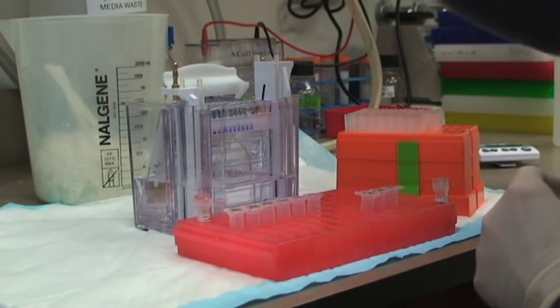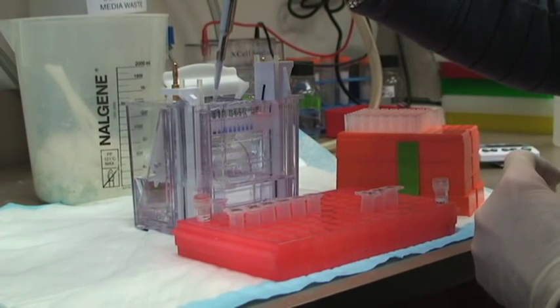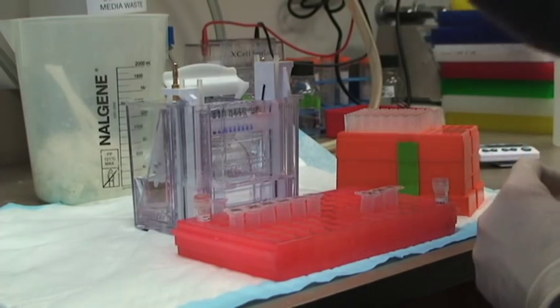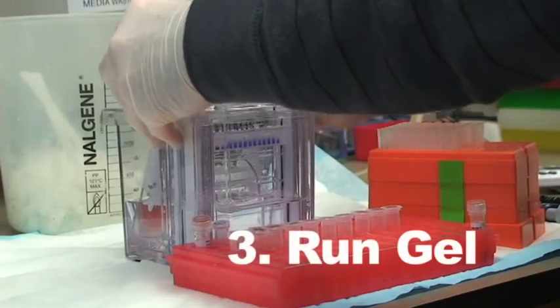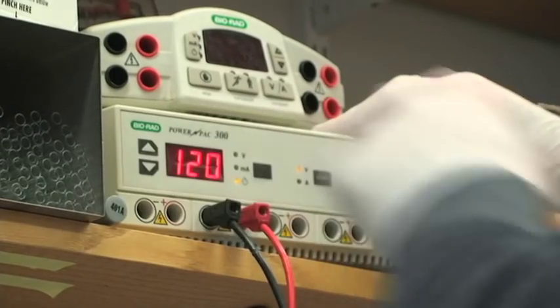Larry's actually loading his samples into two gels, a 12% gel, good for visualizing larger proteins, and a 16% gel, good for visualizing smaller proteins. Now you're going to apply some sort of electric current.